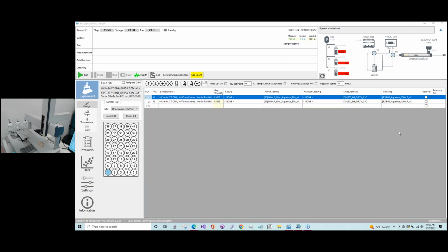So Marina is going to start. This was Stacy, by the way. We're kind of out of view because the focus today is going to be on the instrument and what needs to be done here. So with that in mind, you may not see us most of the time. So Marina is going to start discussing when she comes in the morning, getting ready to do experiments, what is the first thing, the first details that she goes through.